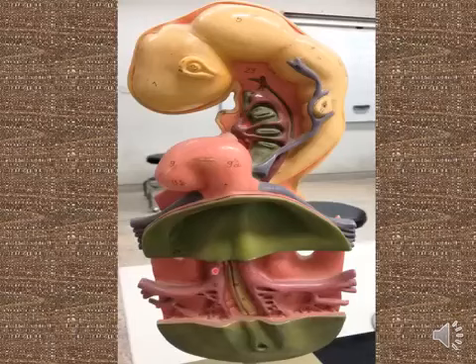You can see bilateral dorsal aorta anteriorly separated by the head mesenchyma, while bilateral dorsal aorta caudally fused, forming a single dorsal aorta. The single dorsal aorta will form the descending thoracic and descending abdominal aorta, where these aorta give many intersegmental arterial branches to each embryonic segment.